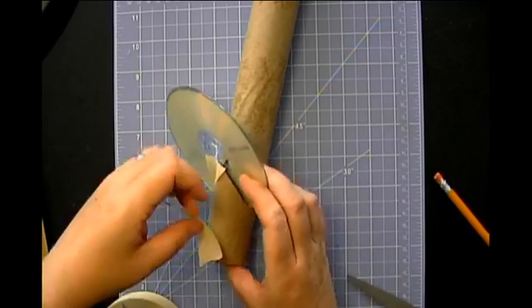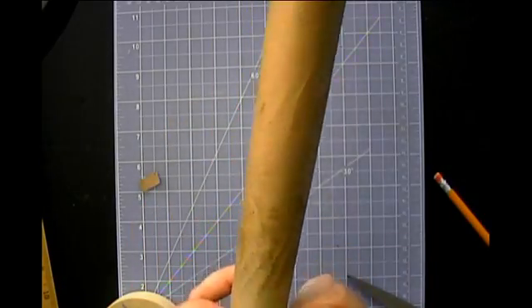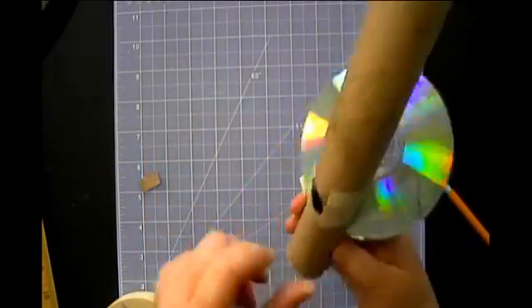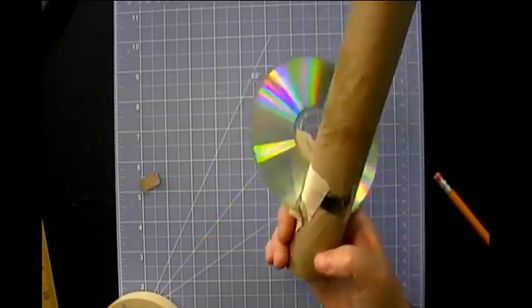I meant to do that on my sample, and things just got a little bit crazy today and I forgot. This happens. Okay, so there we go. So you see, I just put a little tape so that I know that it won't fall out. And there we go. We've got our spectrometer. Pretty simple, right? Now let me show you how to use it.